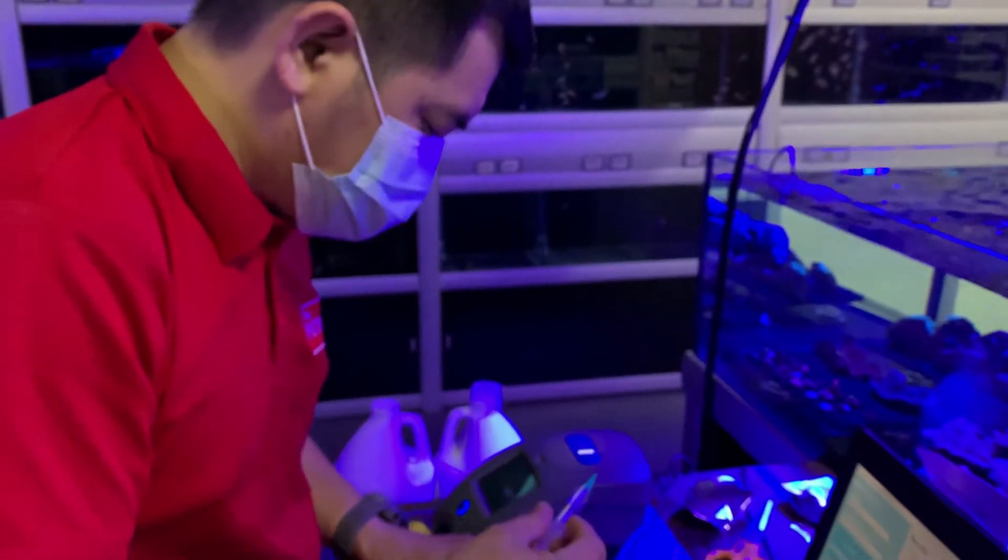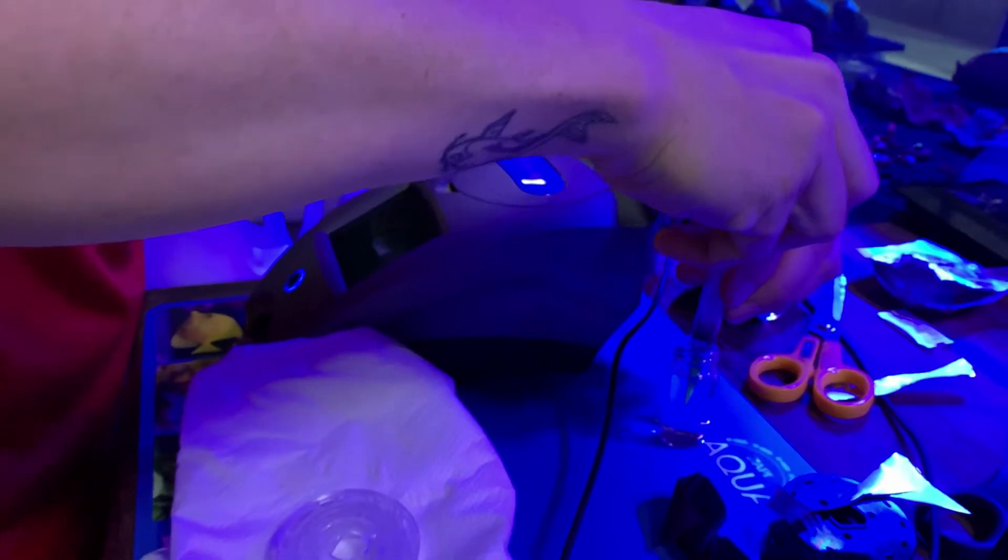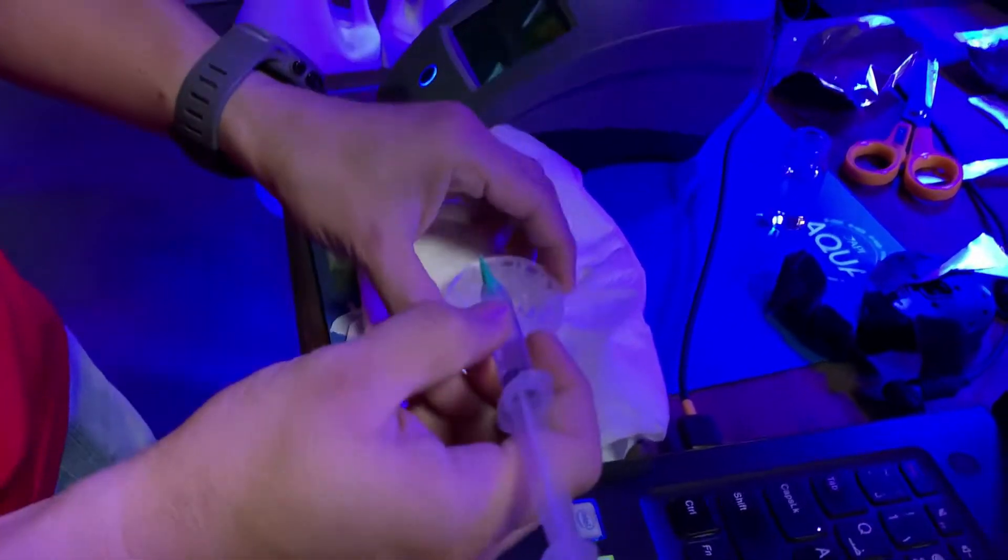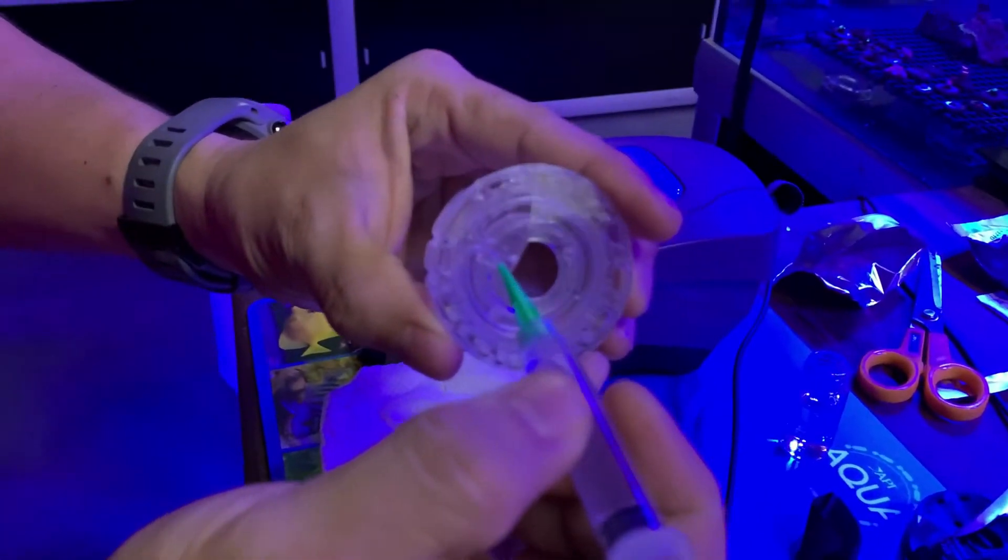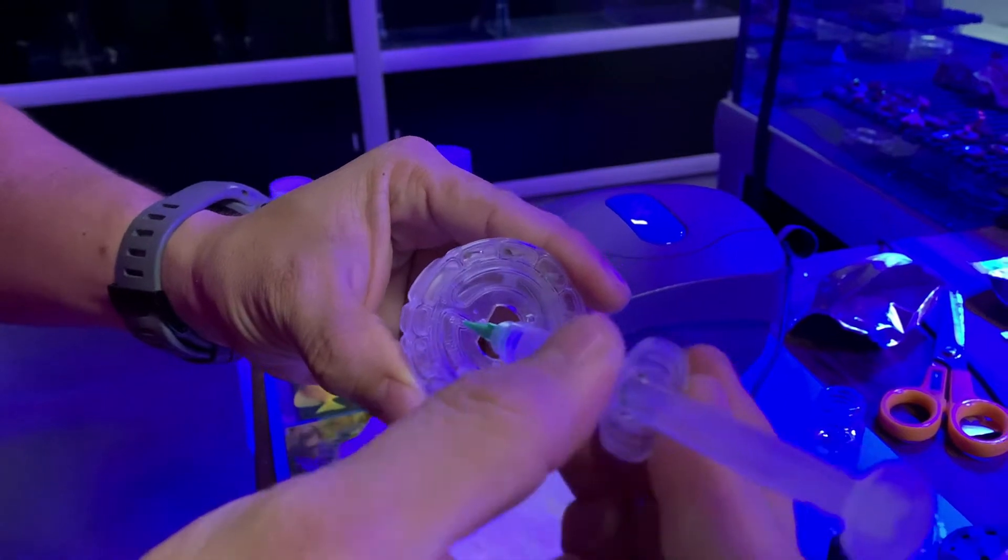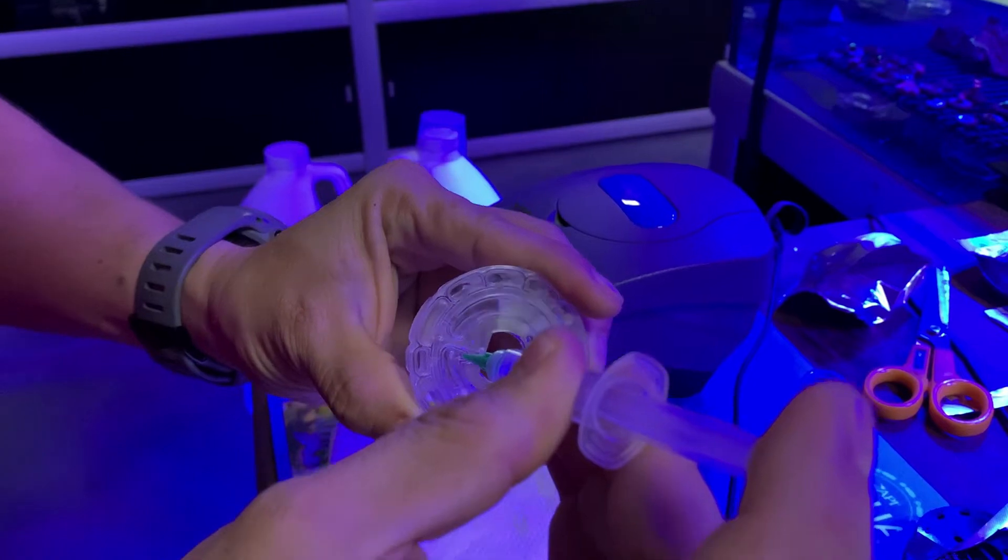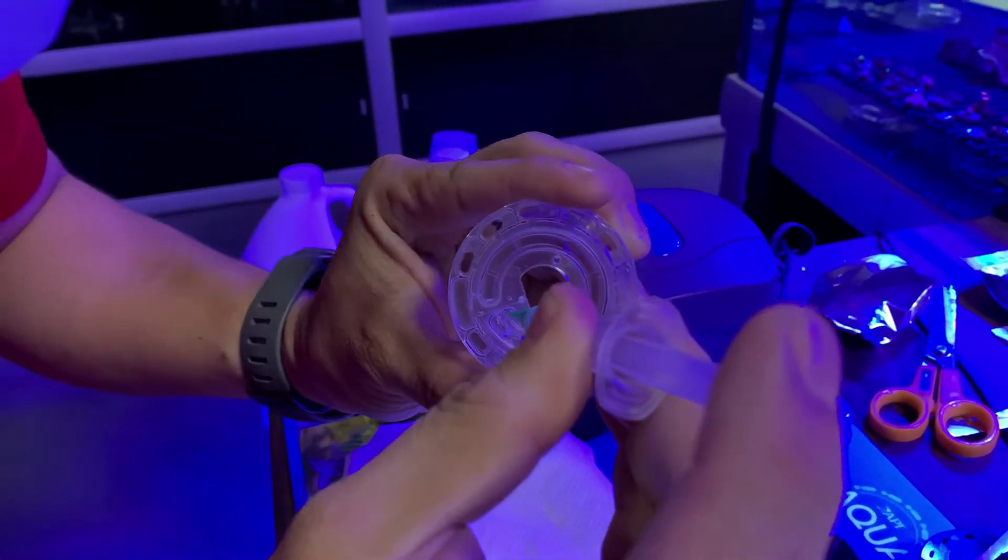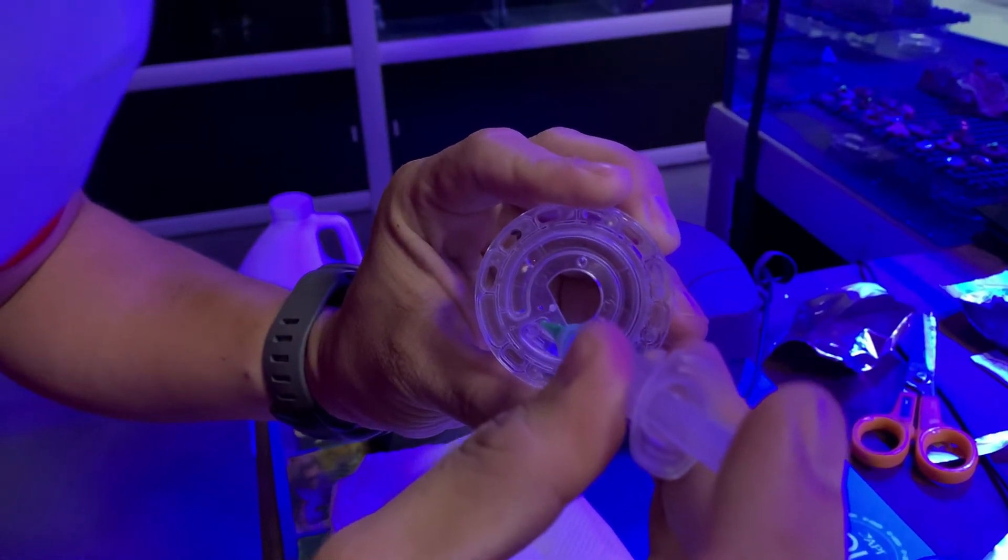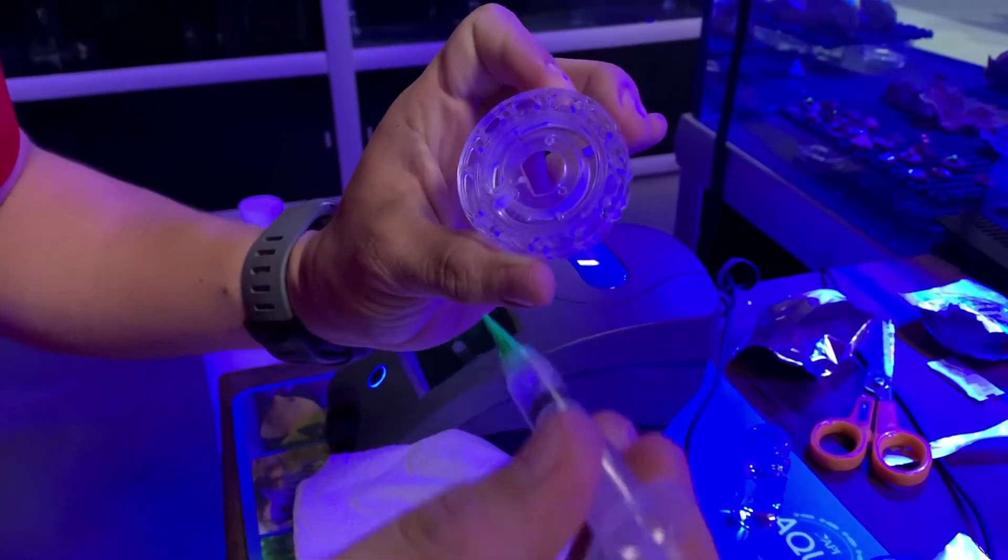Let's get a water sample. Make sure... close it. Let's put the needle here. Put pressure on it so that water will not escape. You can see, it's now filling. Make sure there's no bubbles. What I'm going to do is to shake it to make sure that there's no bubbles.